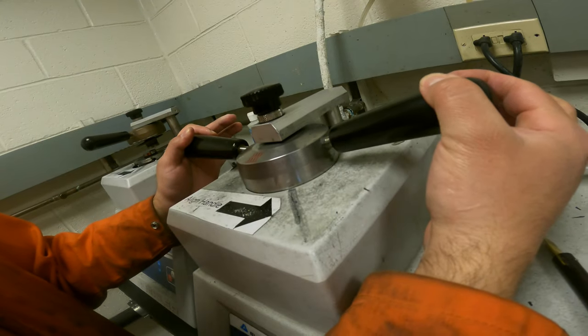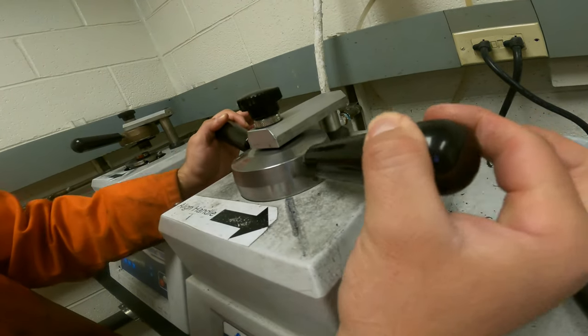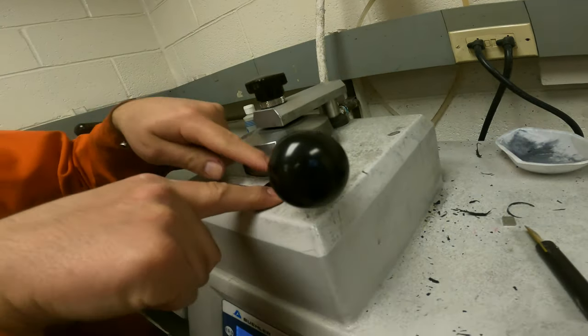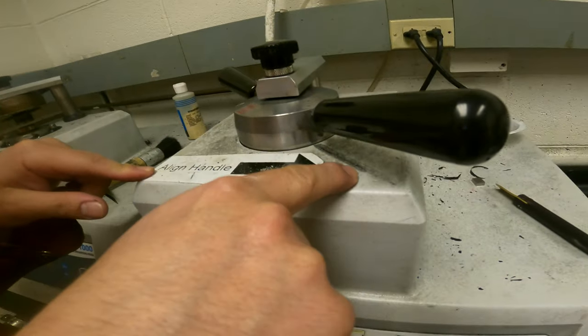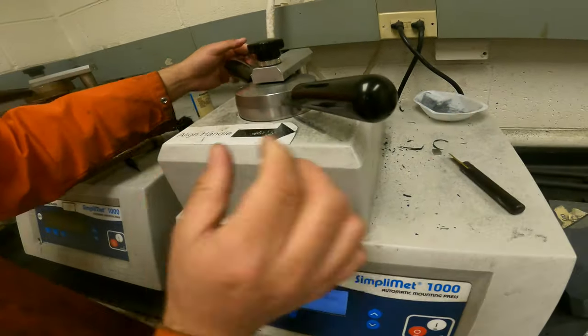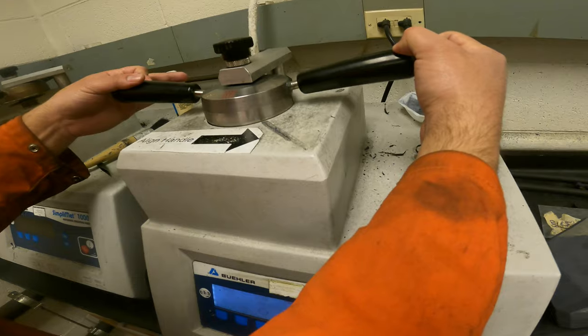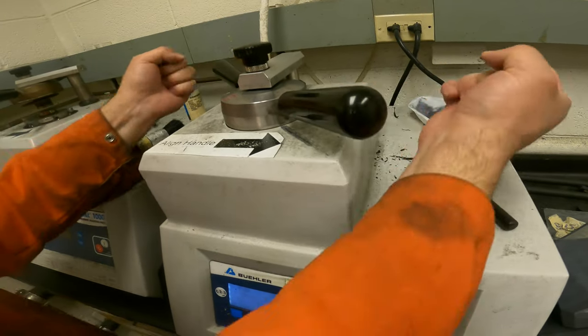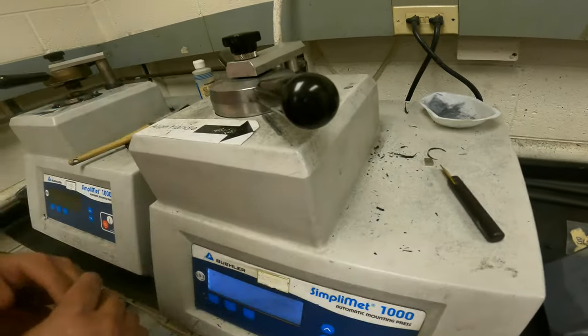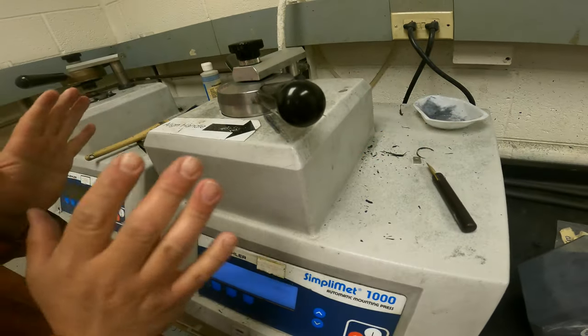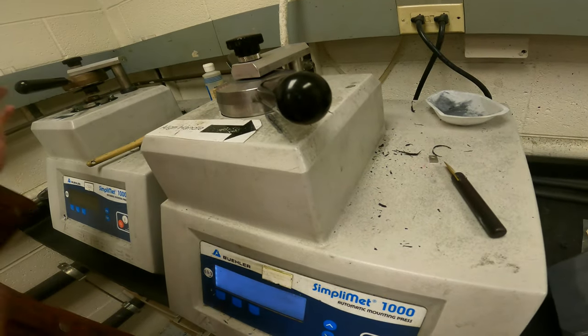It needs to go easily down, push a little bit, all in, and after that, 45 degrees until this mark. You see this aligned handle here. So you don't need to tighten it all the way, just from this position to 45 degrees without any crazy force. If you feel something is stuck, probably something's wrong, so let me know. It needs to be easy.